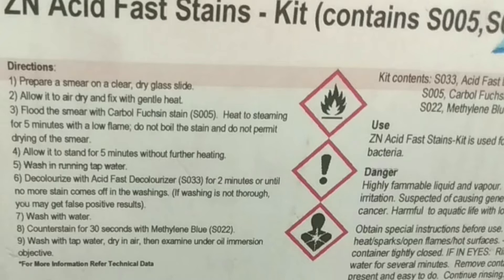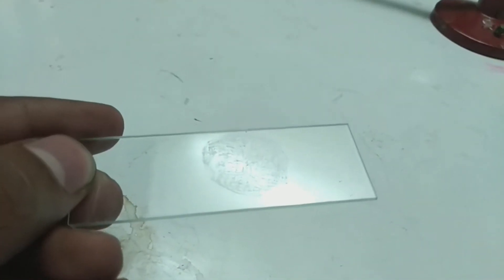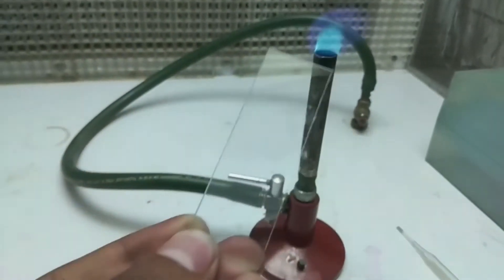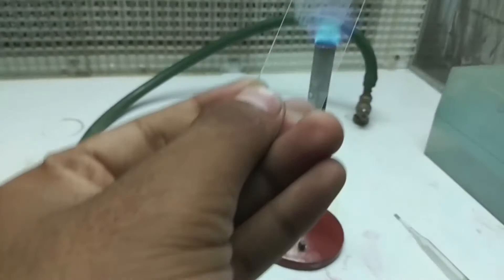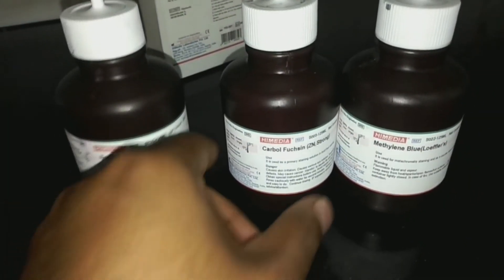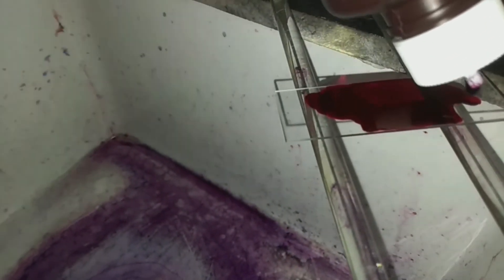First, we make a smear of Mycobacterium species and heat fix it properly so the bacteria adhere to the slide and cannot be washed off. Then we place the slide on the special glass rod arrangement and light the burner. Take the carbol fuchsin primary stain and flood the slide with it drop by drop.